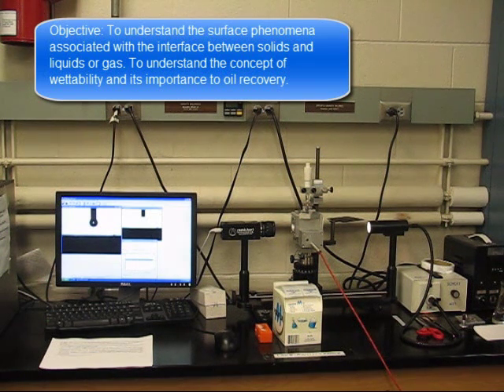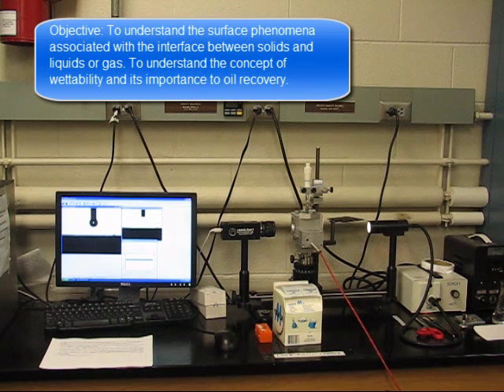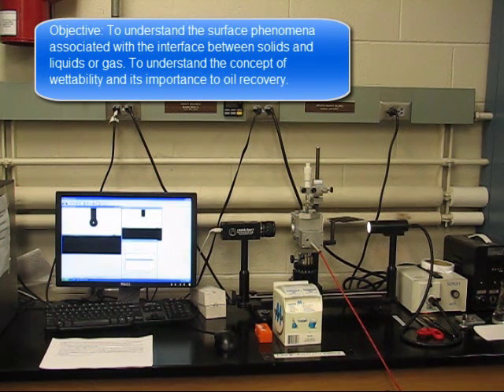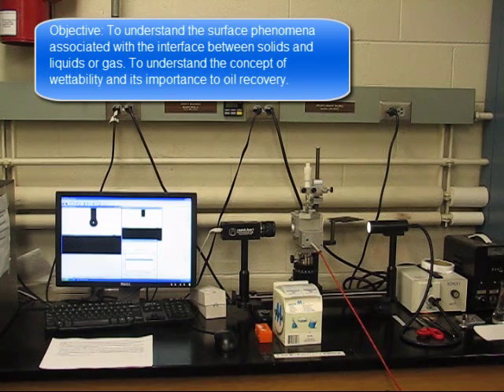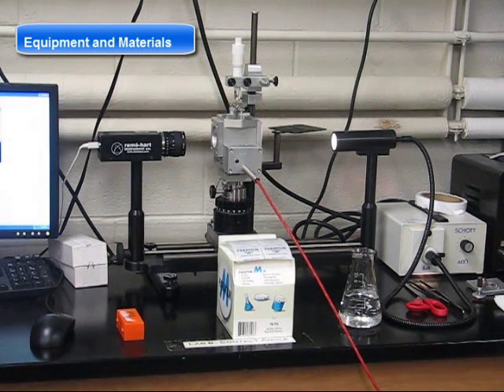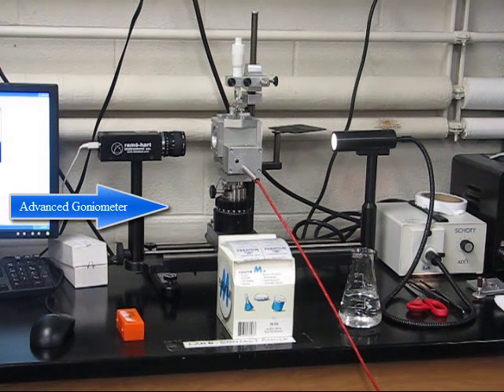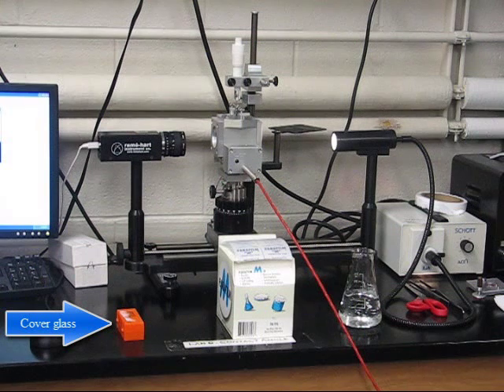The objective of today's lab is to understand the surface phenomena associated with the interface between solids and liquids or gas, and to understand the concept of wettability and its importance to oil recovery. The equipment and materials we're going to use today are the advanced goniometer and the microliter syringe.